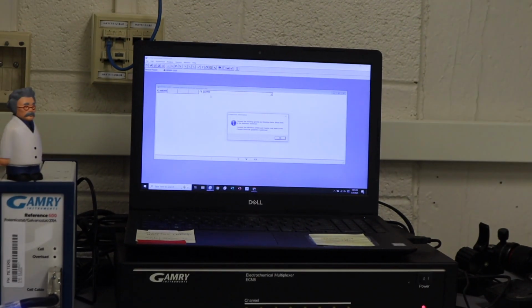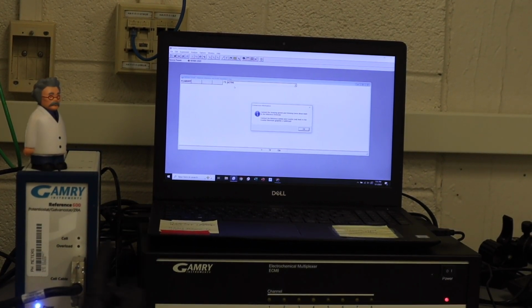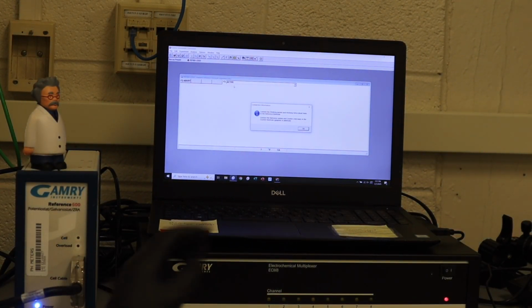And so we will be using this multiplexer here and the potentiostat here. We're going to go through some standard electrochemical measurements and discuss what they should look like, what they shouldn't look like, and why you might see some errors in those measurements. Alright, so let's say you have your entire experiment set up and you wanted to run some characteristic measurements that are really commonly collected when looking at bioelectronics. Say we'll look at electrochemical impedance spectroscopy and we'll look at cyclic voltammetry.